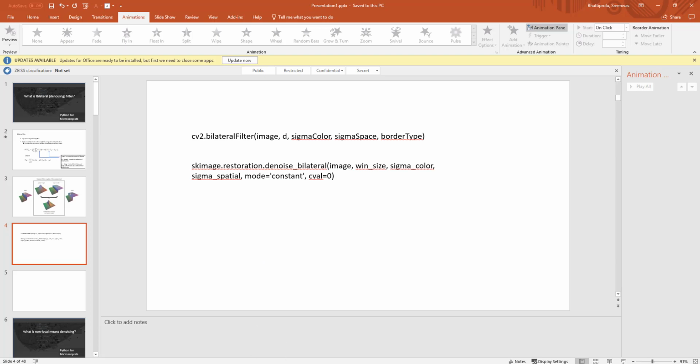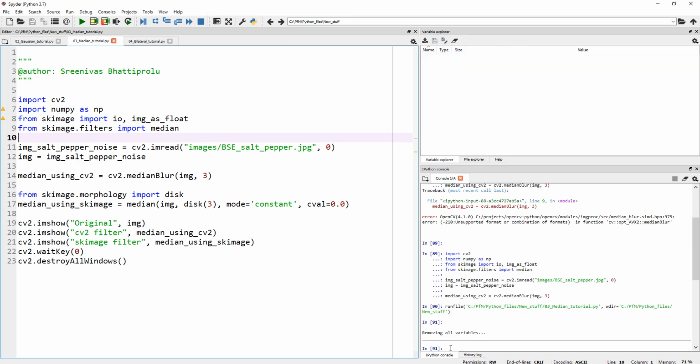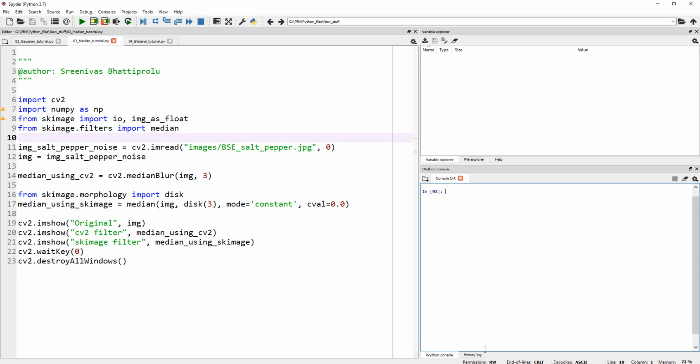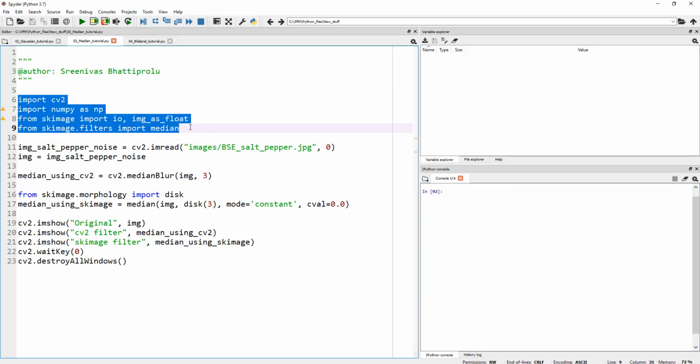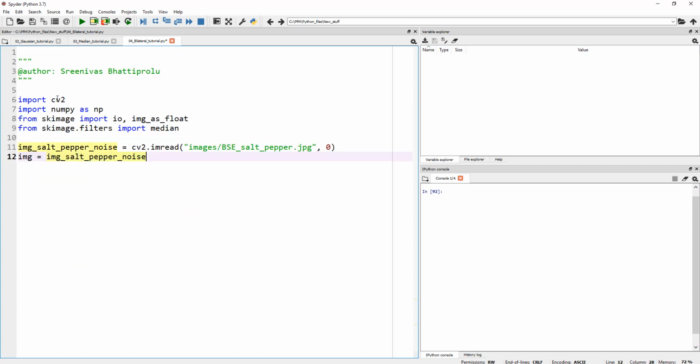Let me open our Spyder interface here, and let me clear some of the variables from our last tutorial where we talked about median filtering. Okay, so now let's go ahead and start. In fact, let me copy these lines of code here so we don't have to rewrite it. So I'm importing my OpenCV, NumPy, and I'm importing my scikit image. I'm not sure if we need this, but let's leave it for now. And from scikit image filters, import median. I don't think we need to do that. We are not doing median.